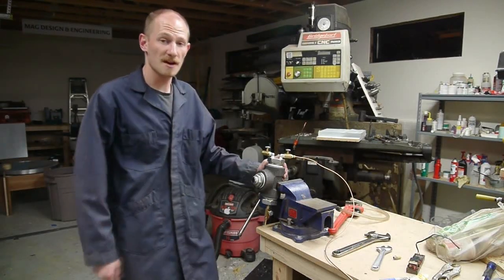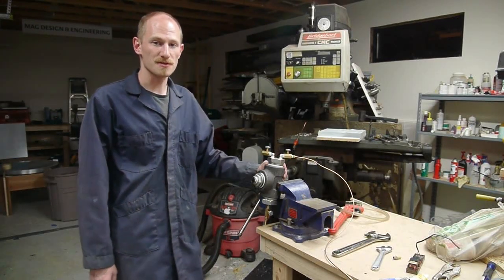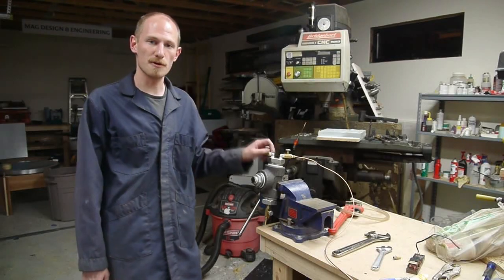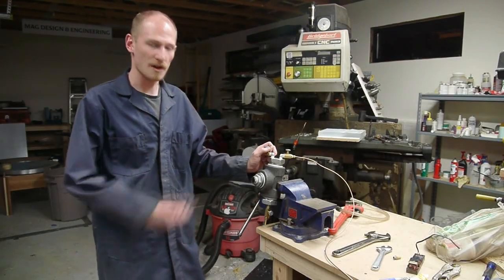Hey everyone, I finally got some chemicals to make aerogel, and in preparation I built this supercritical drying chamber. Let me show you how it's built.